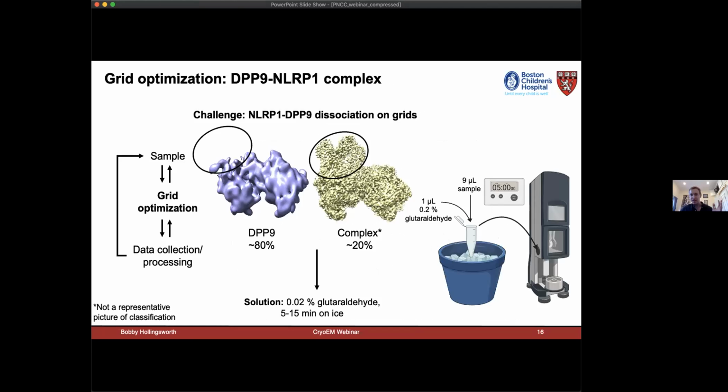So now that we have this prep that's reproducible, we decided to start screening on cryo-EM grids. And we were noticing from our small data sets that we were getting this dissociation in grids that I just alluded to, where most of our particles were aligning to these empty DPP9 particles that were missing NLRP1. We were losing about 80% of our data due to that. And this is probably just due to dissociation at the air-water interface, because the protein complex purified together and the stoichiometry looked very good by SDS-PAGE.